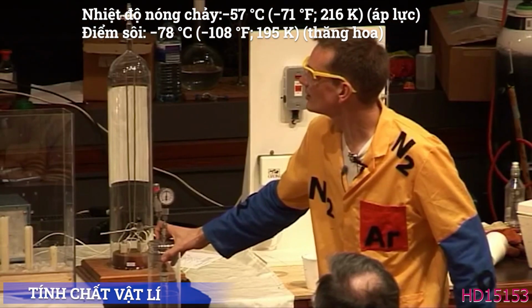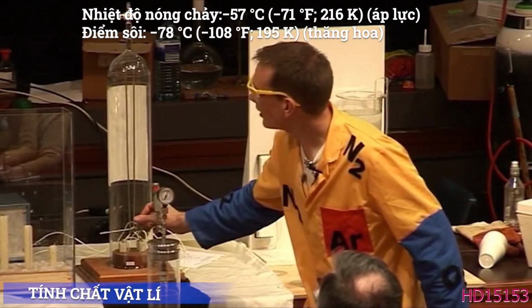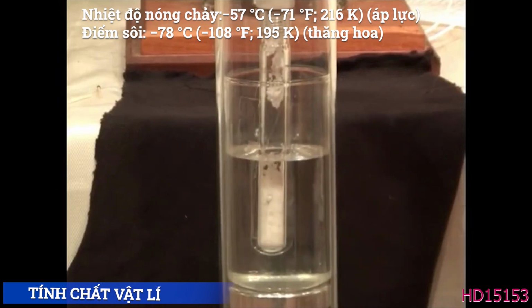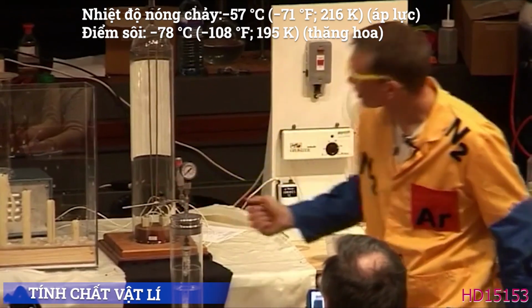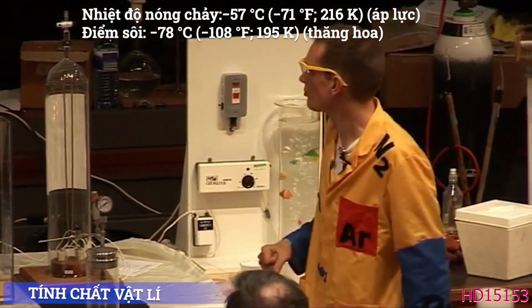There we are. Now if I release the pressure very, very quickly, okay, watch what happens. It's gone back to the solid as the pressure's released, because it's still very, very cold. Now I'll close it off again, and then that will help it melt again as the pressure builds up, and the whole thing will do it again.